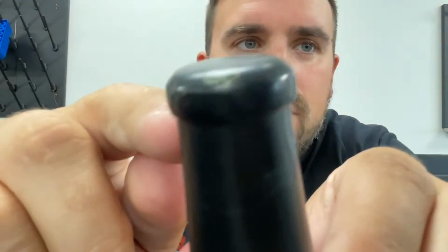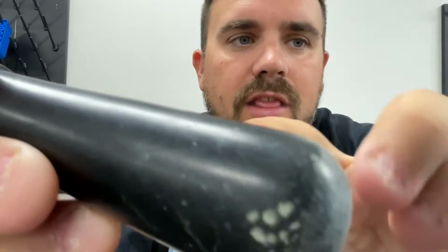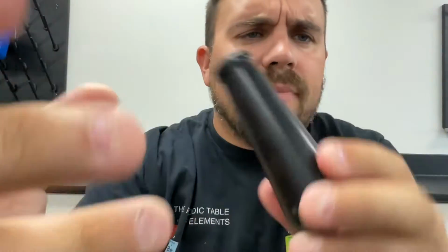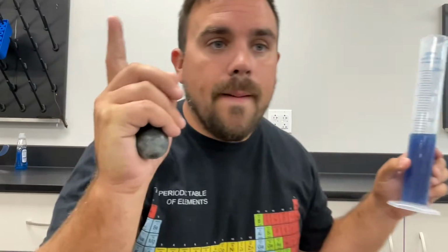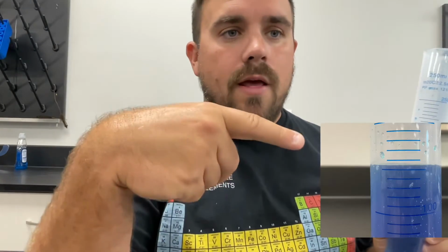Like you see that lip there, it gets thicker as it comes down. This is a very weird shape, and it would require very complex mathematics to actually calculate the volume using an equation. In the lab, it's much easier than that. What we use is our understanding of how to measure liquids to help us figure out the volume of irregularly shaped objects. So what I've got here is a graduated cylinder, and you can see the image of that right down there.